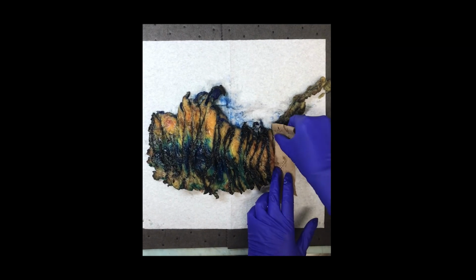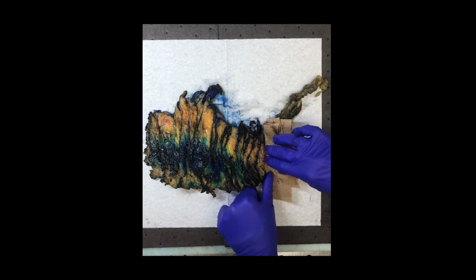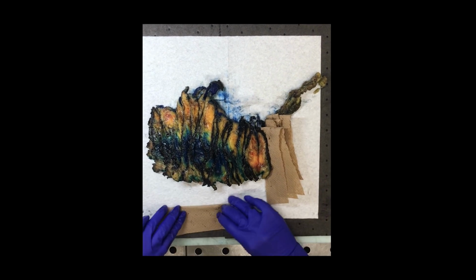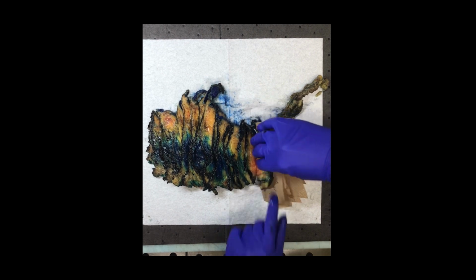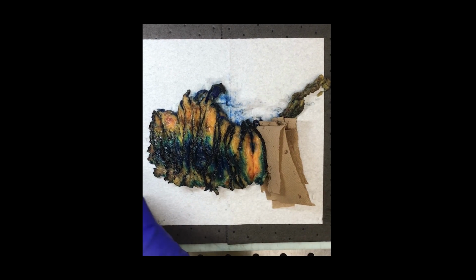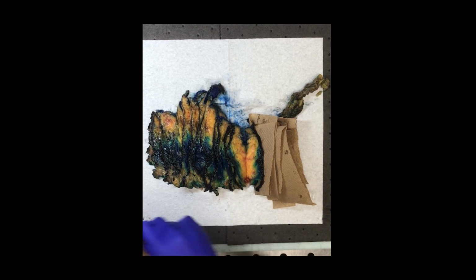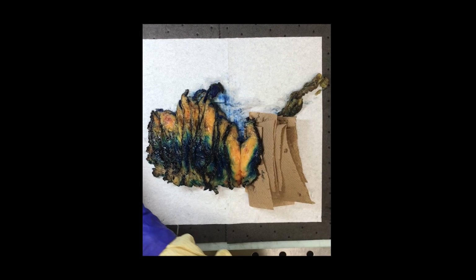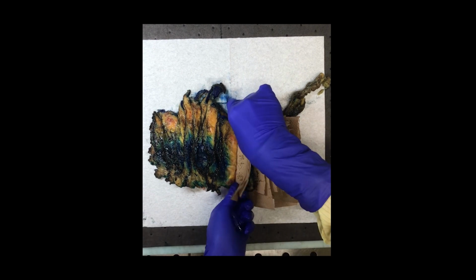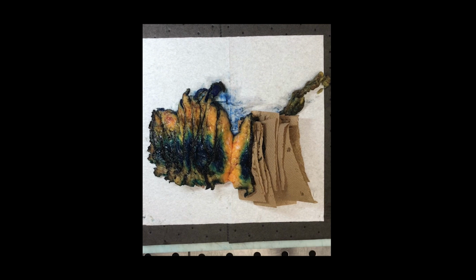Our next step is putting paper towel in between each one of the slices. This allows the formalin to really penetrate into the breast tissue. It's really important when I'm putting these slices down onto the paper towel that I'm not pulling and distorting the breast tissue. I'm just gently laying the breast tissue down on the paper towel and not distorting the shape at all. I would continue doing that throughout the rest of the breast specimen.